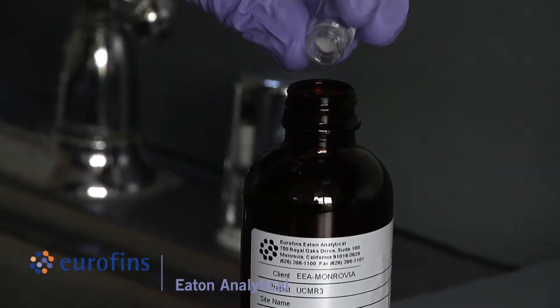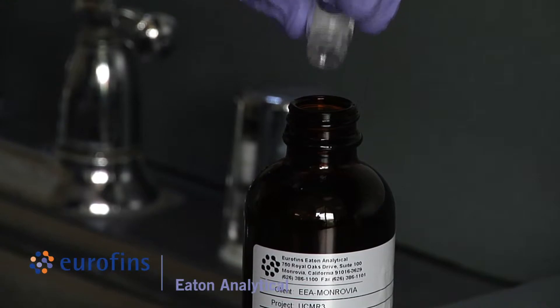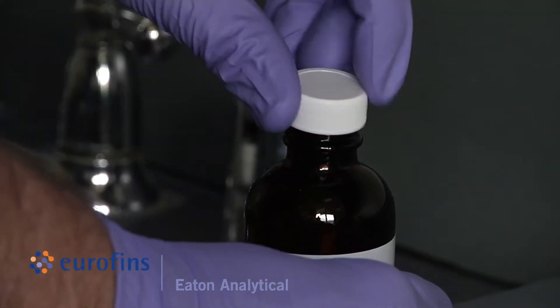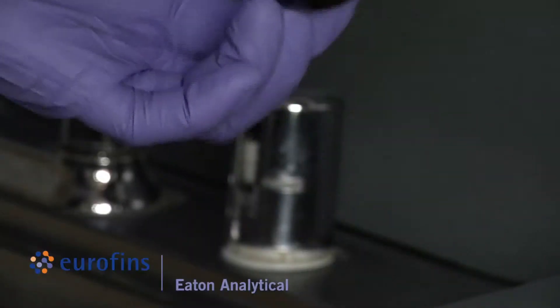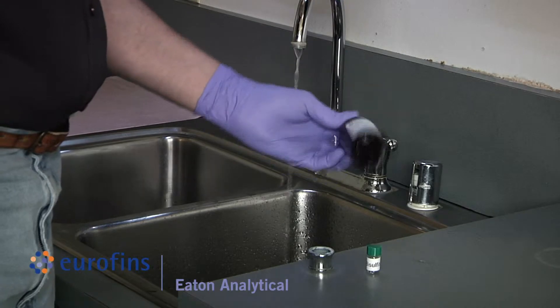Add the sodium bisulfate by shaking out from the vial. Use appropriate caution when handling sodium bisulfate since it is highly acidic. After adding sodium bisulfate, cap and invert the bottle at least five times or until the sodium bisulfate is dissolved.